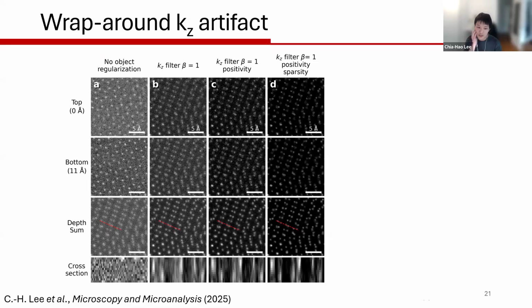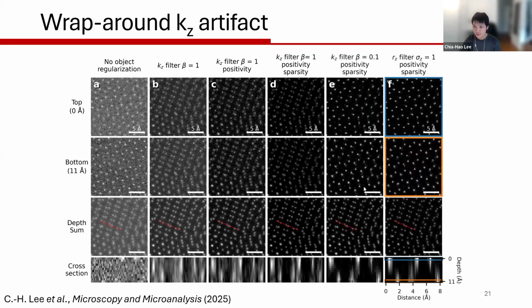That is the reason why in PtyRAD we implemented a real space regularization, so that the top layer and the bottom layer can now be nicely decoupled, as you can see. But this wraparound artifact is very common for most multi-slice electron ptychography reconstructions, unless you do the regularization in real space to get rid of it. For example, if you have a tilted crystal, this wraparound artifact will literally slap the bottom layer on top of your top layer, making ghost images of your reconstruction.